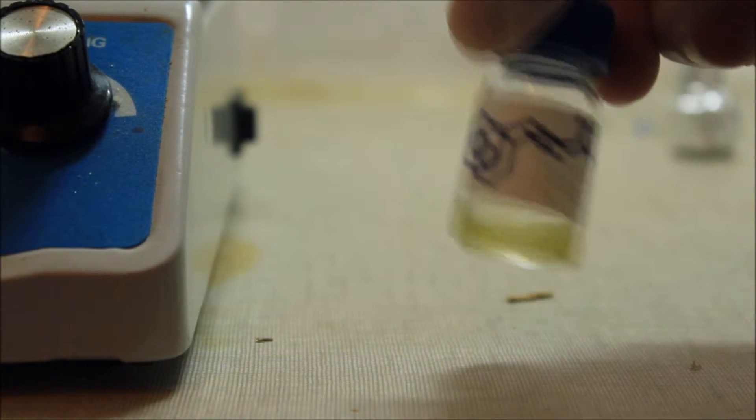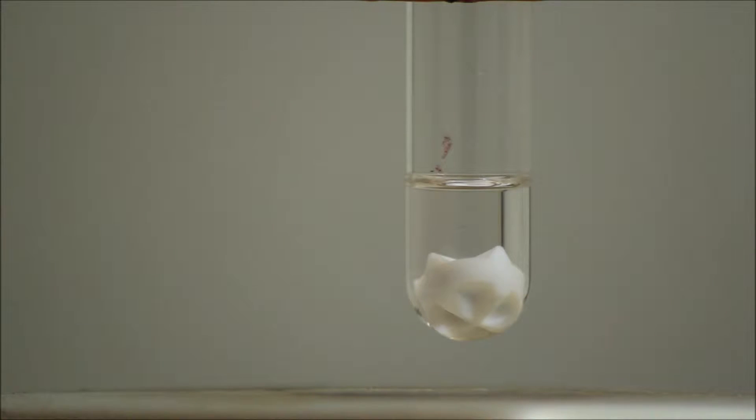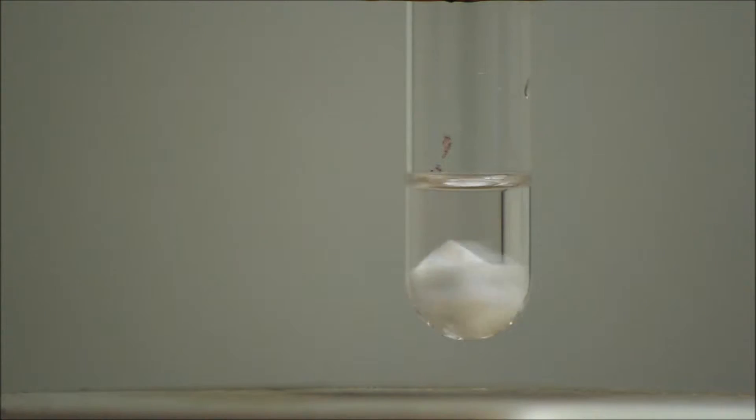In a previous video we made cinnamaldehyde, a yellow oil responsible for the flavor and odor of cinnamon. Chemically speaking, it is a quite interesting molecule. It is able to react with other carbonyls such as acetone in a reaction known as an aldol condensation.